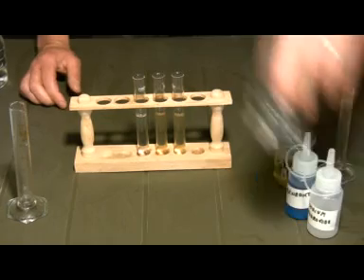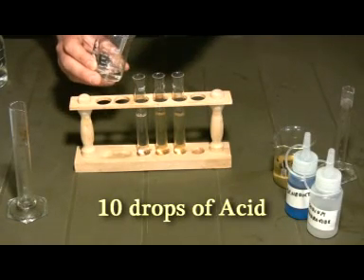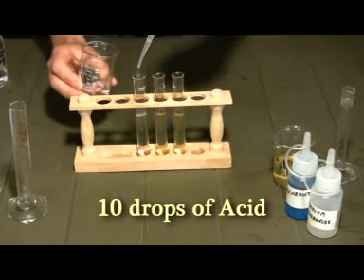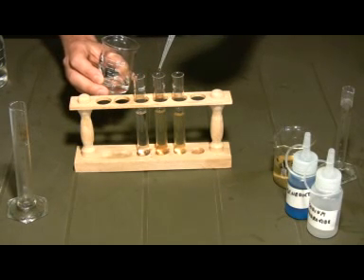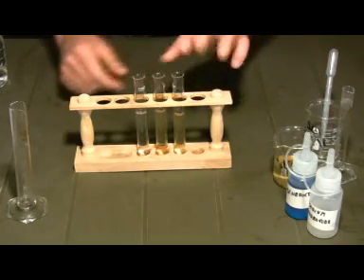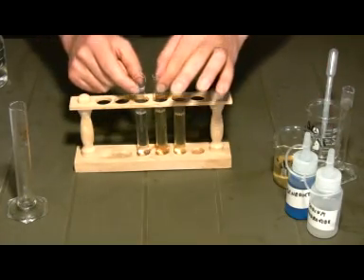We're going to add a few drops of hydrochloric acid in the test control. This one we don't put any hydrochloric acid, we'll leave it aside.